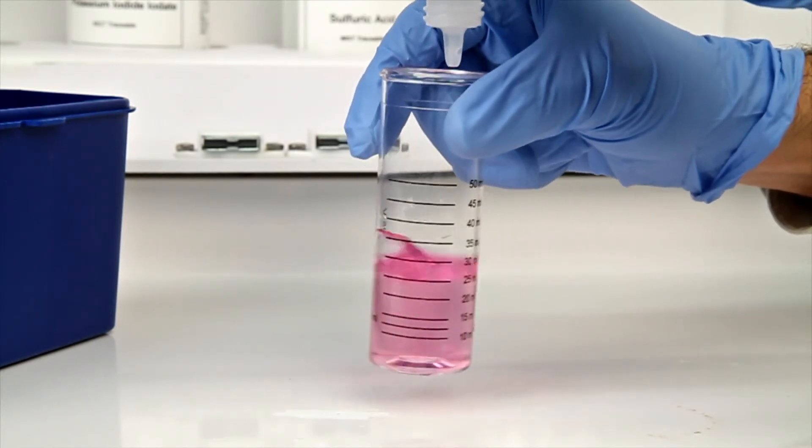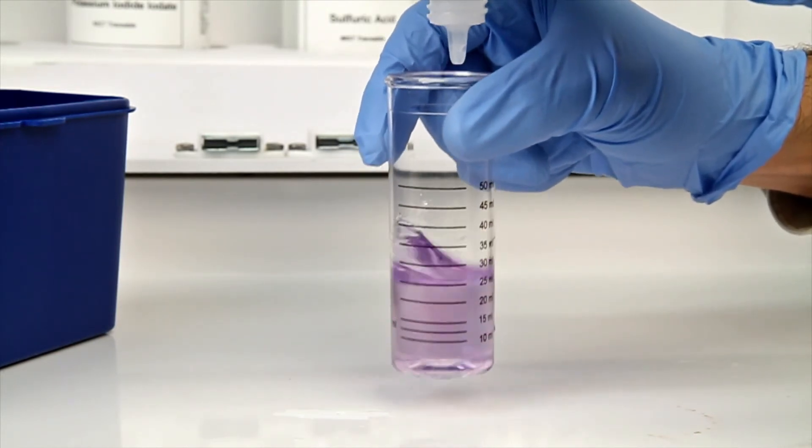According to the Endpoint ID procedure, the titration is complete when the sample changes from red to blue.